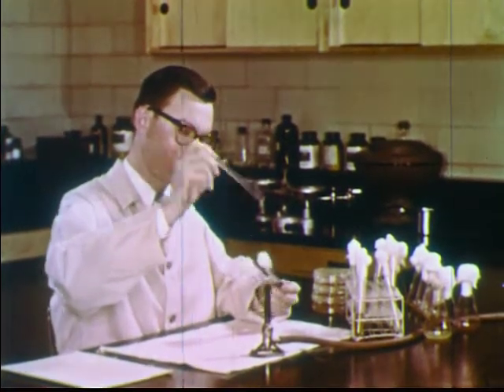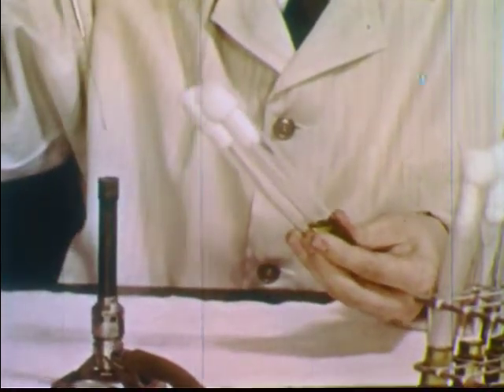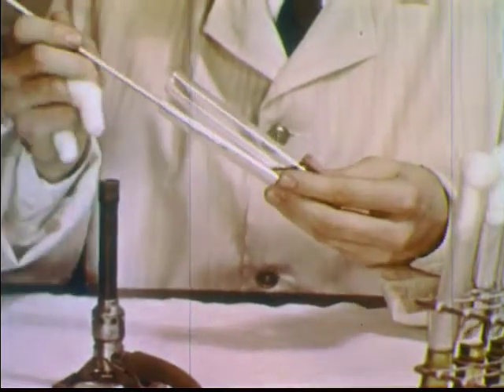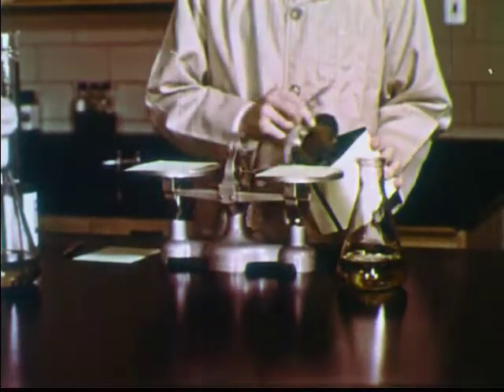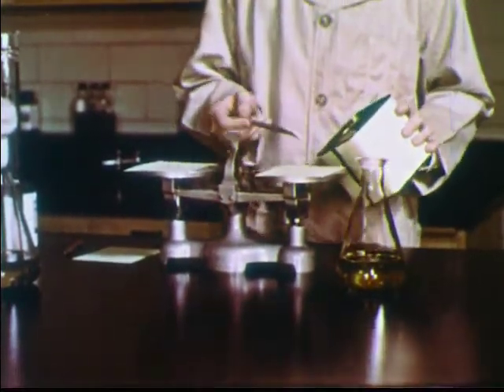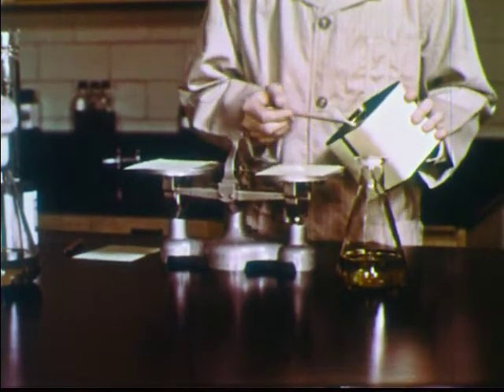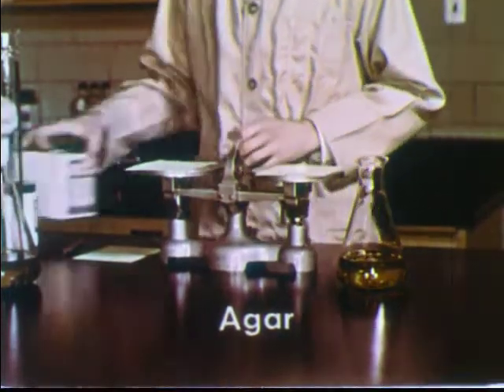Although the microscope is useful in the study of bacteria, to learn more about these microorganisms it is necessary to grow them in the laboratory. This permits study of characteristics important in understanding the activities of bacteria in nature and in disease. Bacteria are grown on food materials containing the same elements as those required by larger living things. If a solid medium is needed, agar obtained from seaweed is usually added.